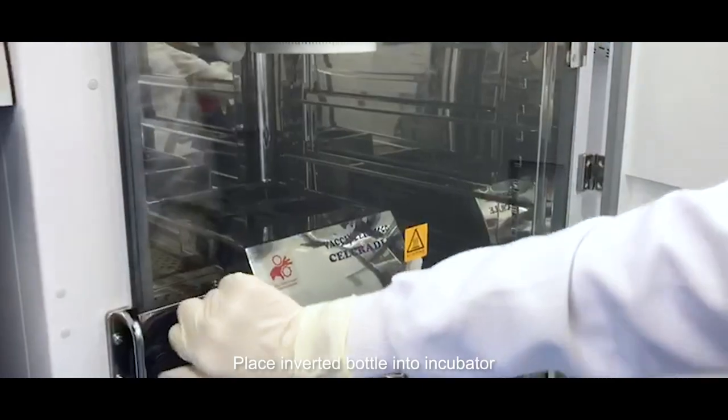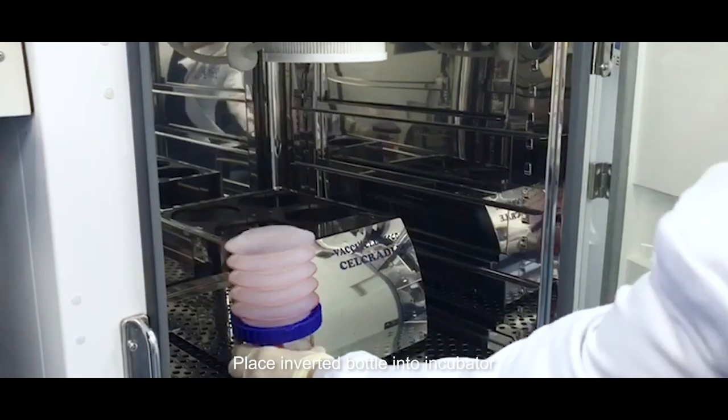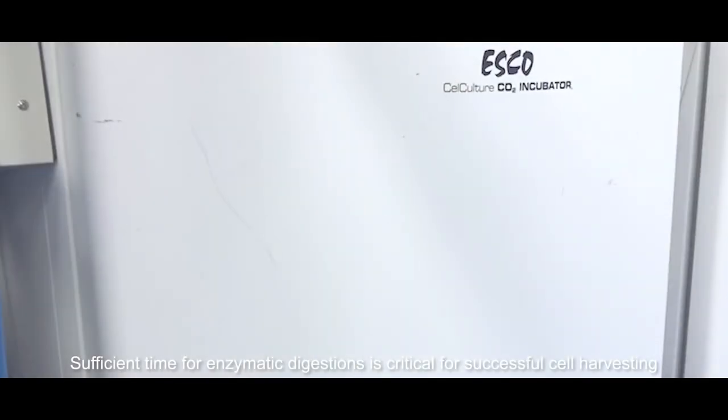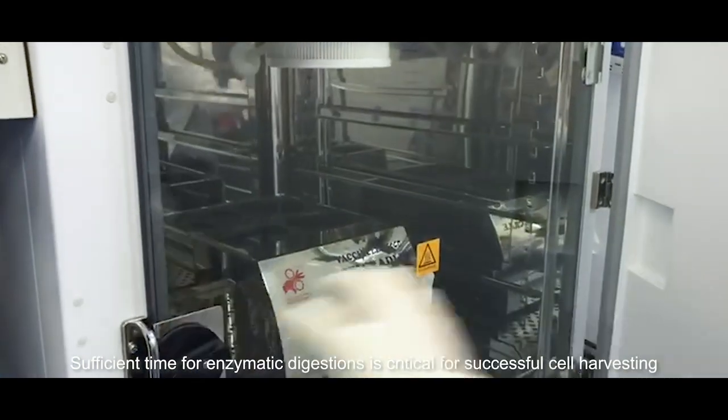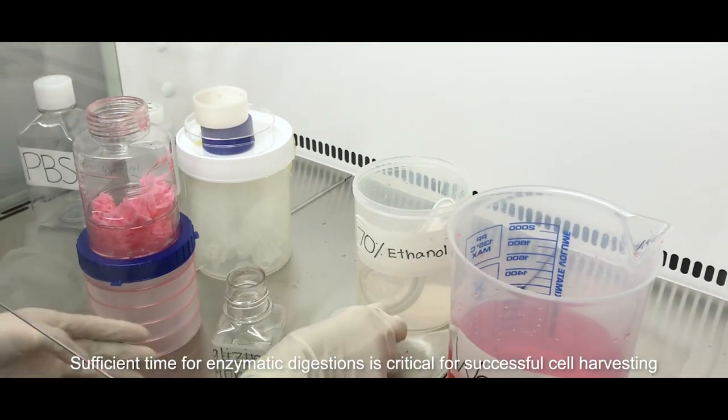Sufficient time for enzymatic digestion is critical for successful cell harvesting. Once the incubation period is over, retrieve your bottle from the incubator and head to the ESCO biological safety cabinet.